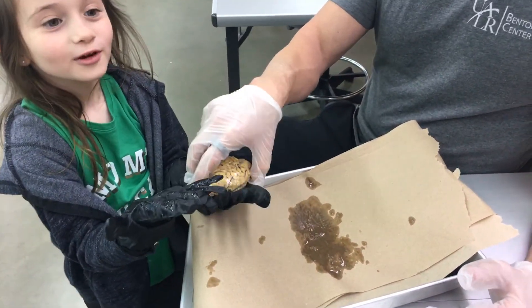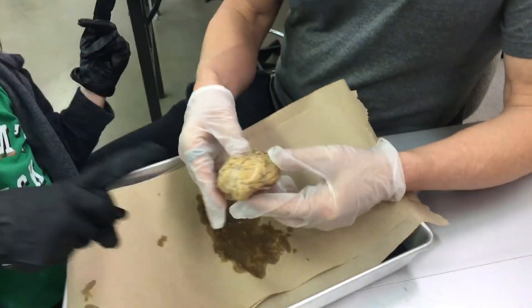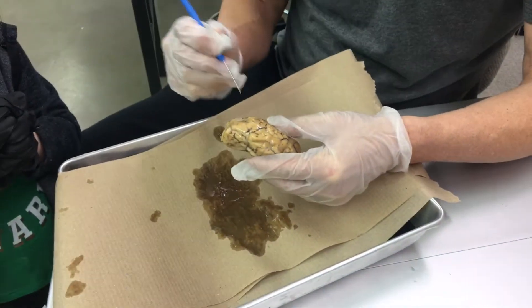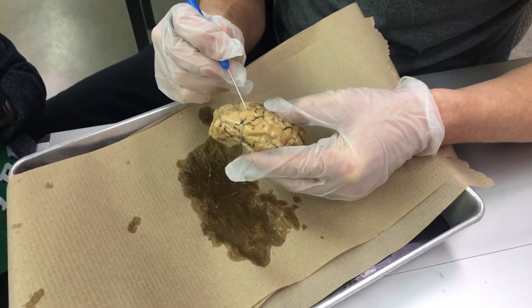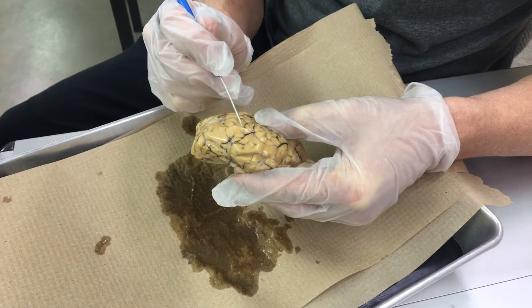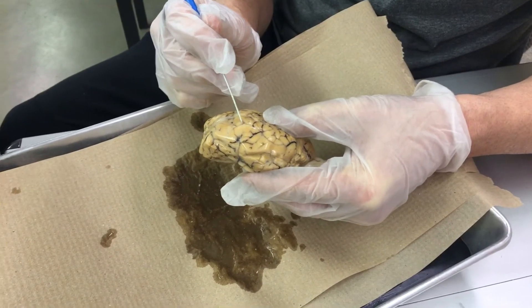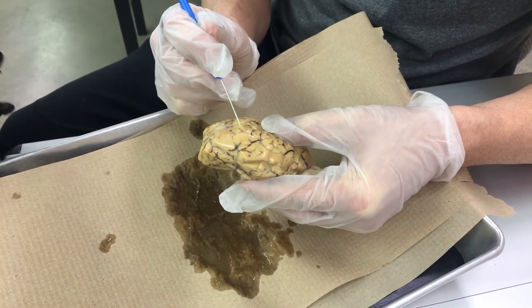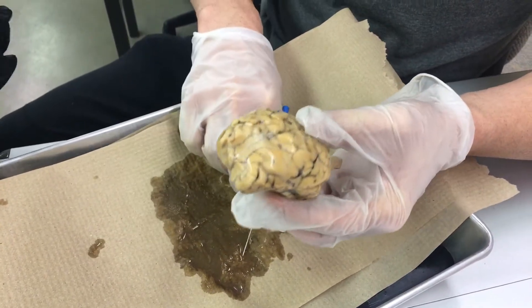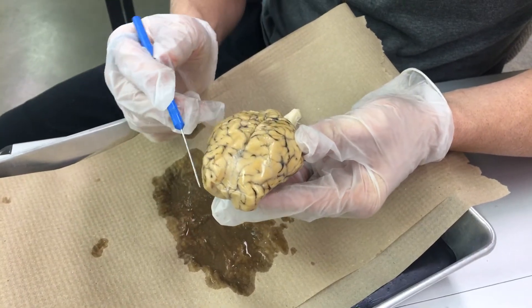So with the sheep brain, you have these little mountains. Those are called the gyrus, and the plural form is gyri. And then in between those gyri, you have a sulcus — that's like the valleys. And the plural form of sulcus is sulci.